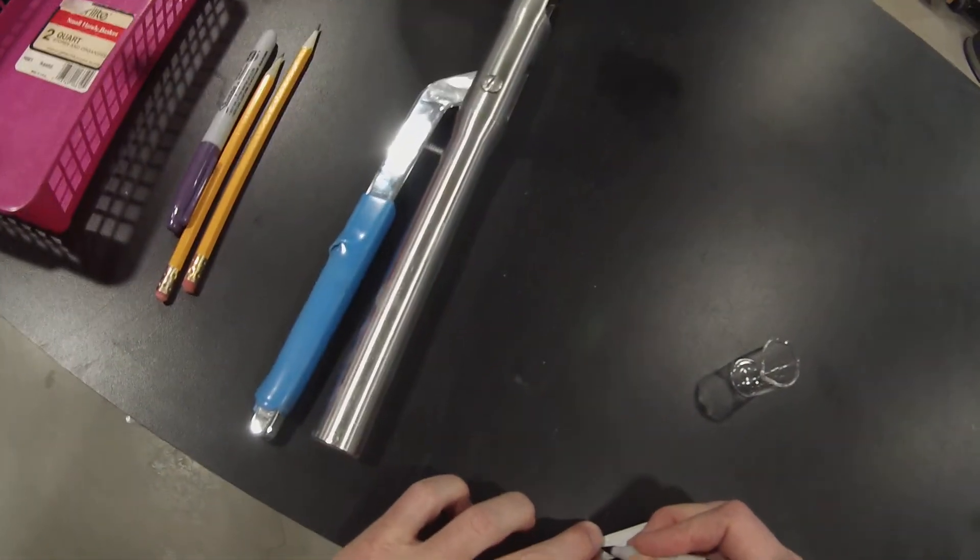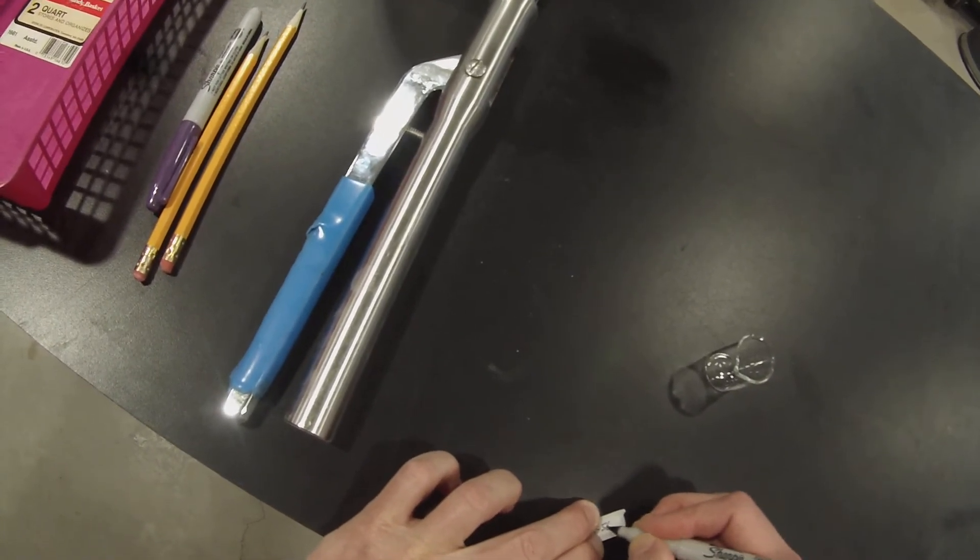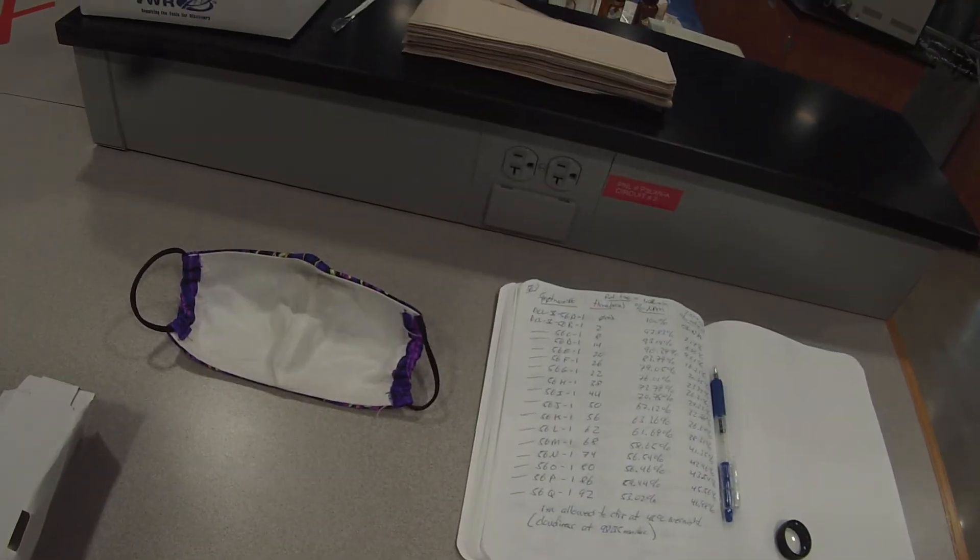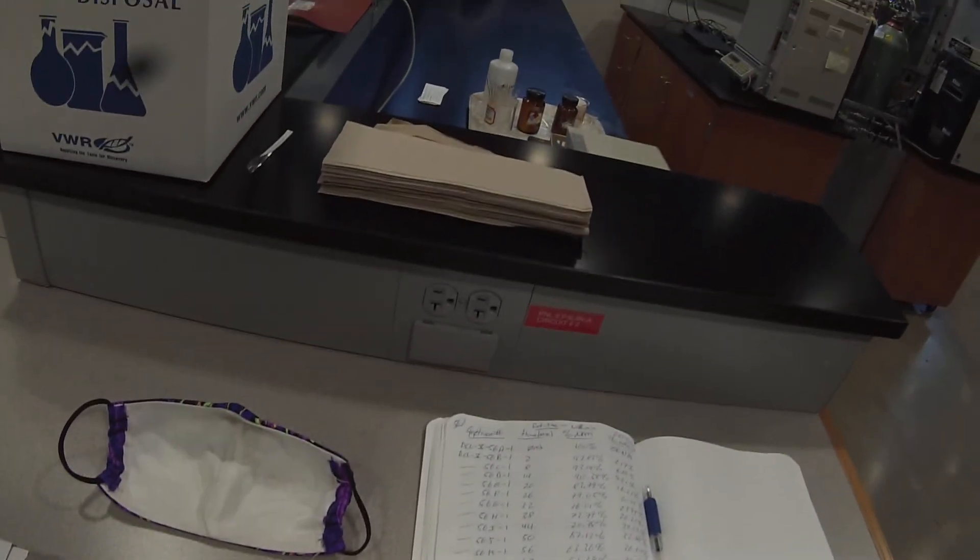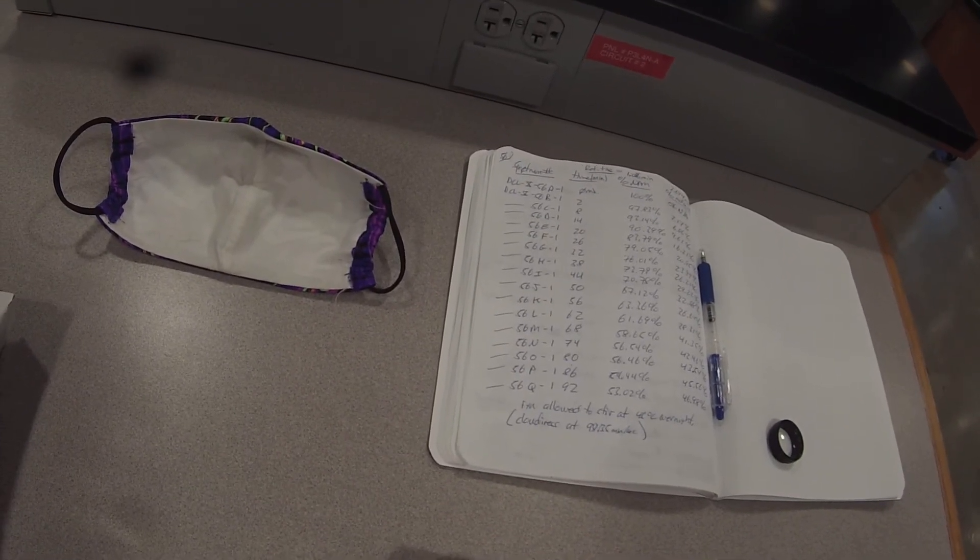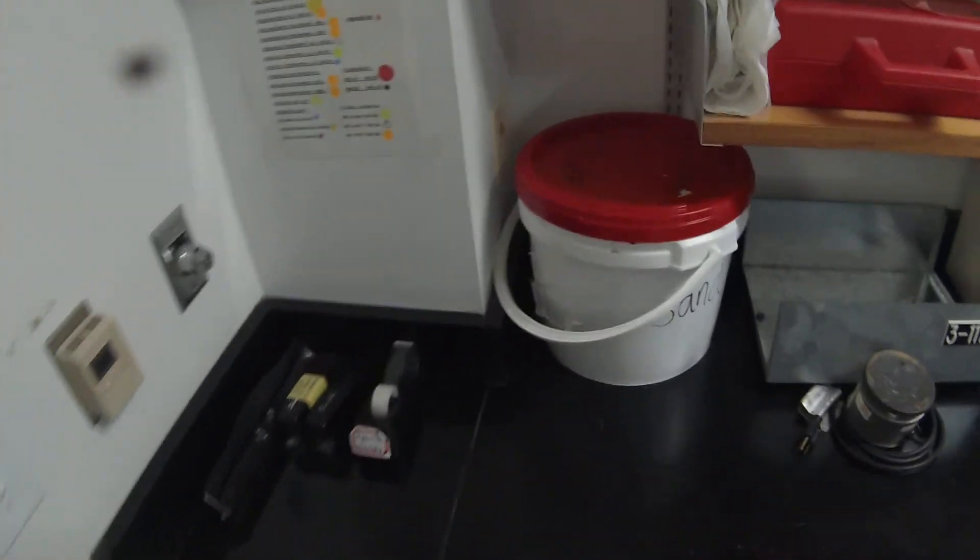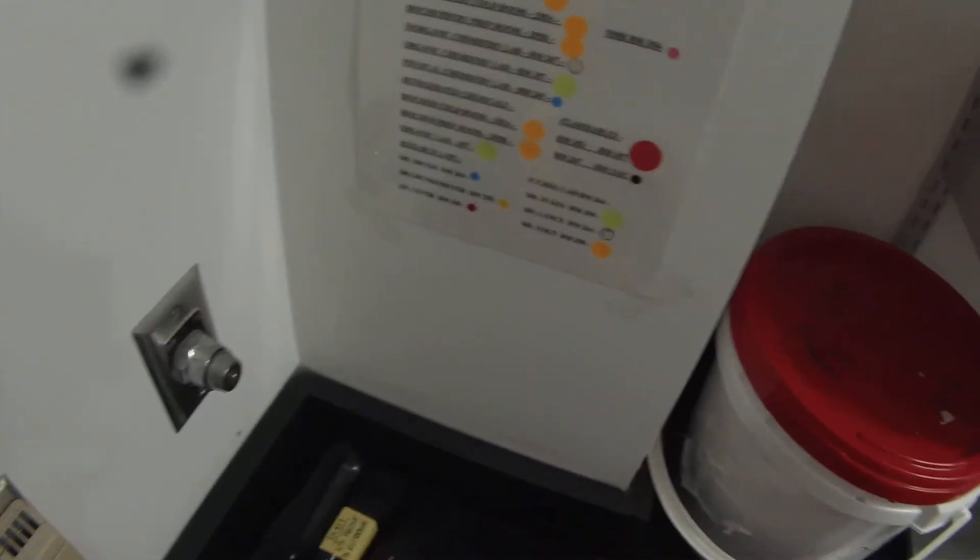So this is DCL-10-56, and it's the solid the next day. So this is 56R. Here we are.